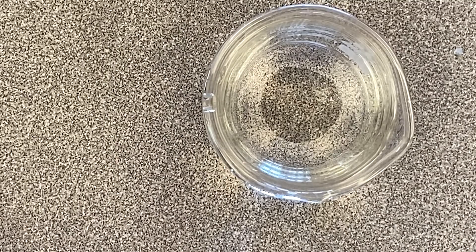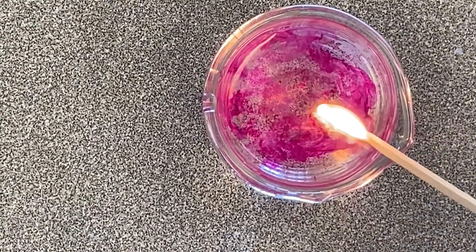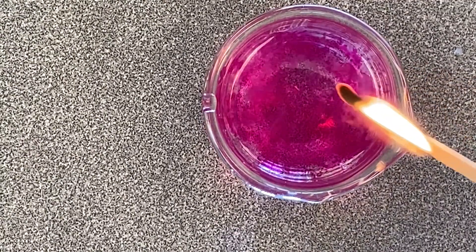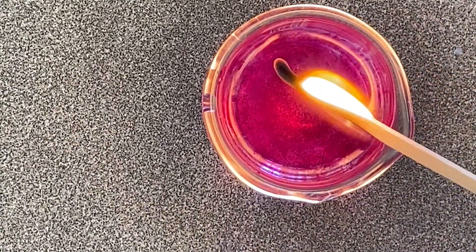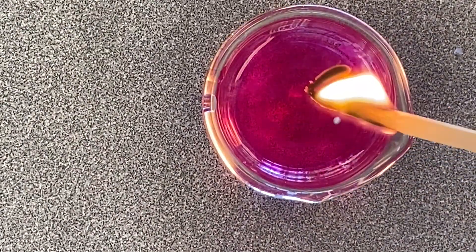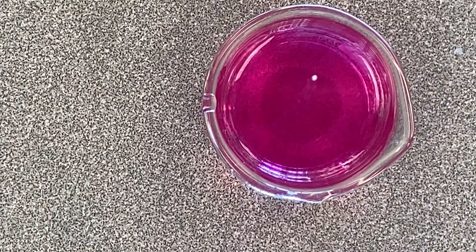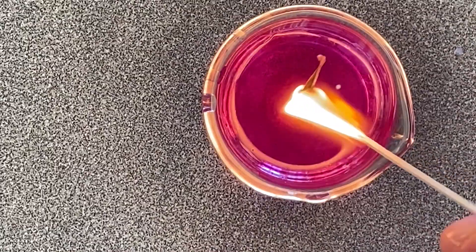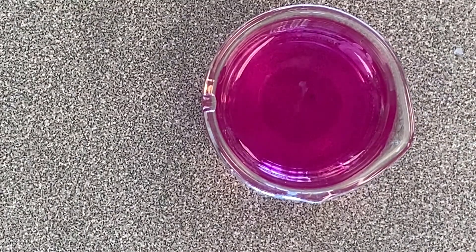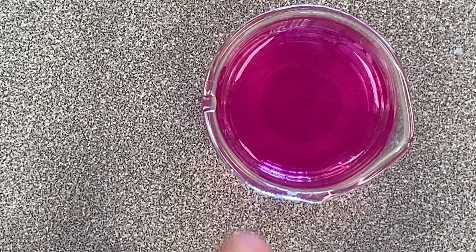We should also be able to light that hydrogen gas on fire. I've got a little splint — you can hear it. The gas that's being produced is indeed flammable. It's a little hard to tell — I heard one little poof there. There we go, and it turned pink. So now we have a base: sodium hydroxide.